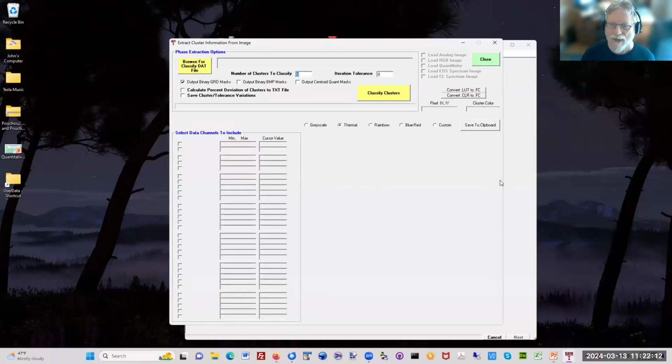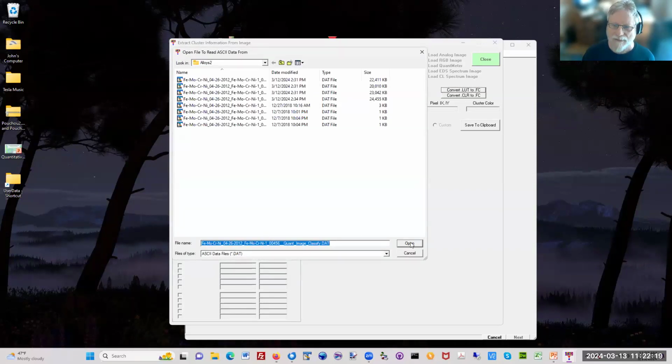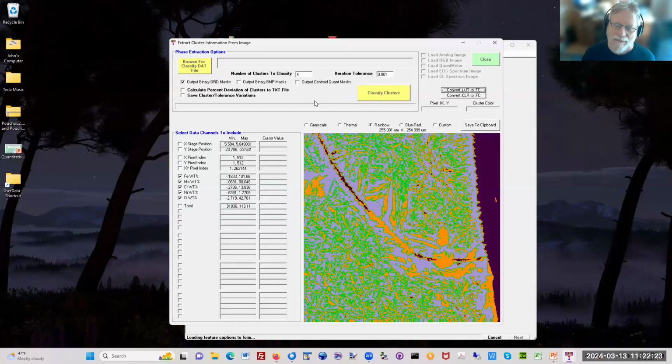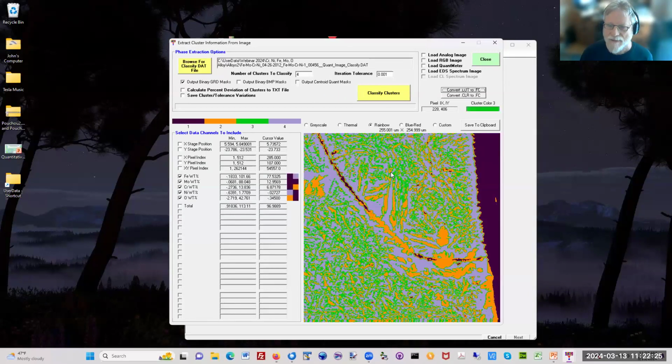One is something that the geologists like to do. You can open up that project. It defaults to this here. And you can say, let me identify the phases in each of these things. I've already done this. It takes about a minute to do, so I'm not going to do it, but I did it already. You can see the different phases here and clusters. You give it a tolerance, and you give it the number of phases you want to divide it into. That's your call to make.